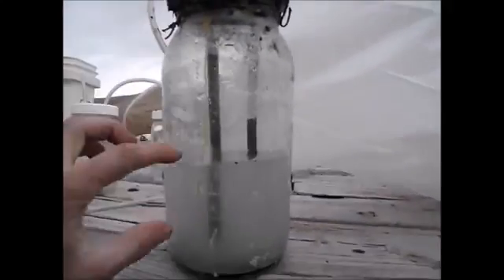We're two weeks in, and you can see the quantity of liquid that I have left is less than half of what I started with. This is a bag of gas that I collected off of this towards the end there.